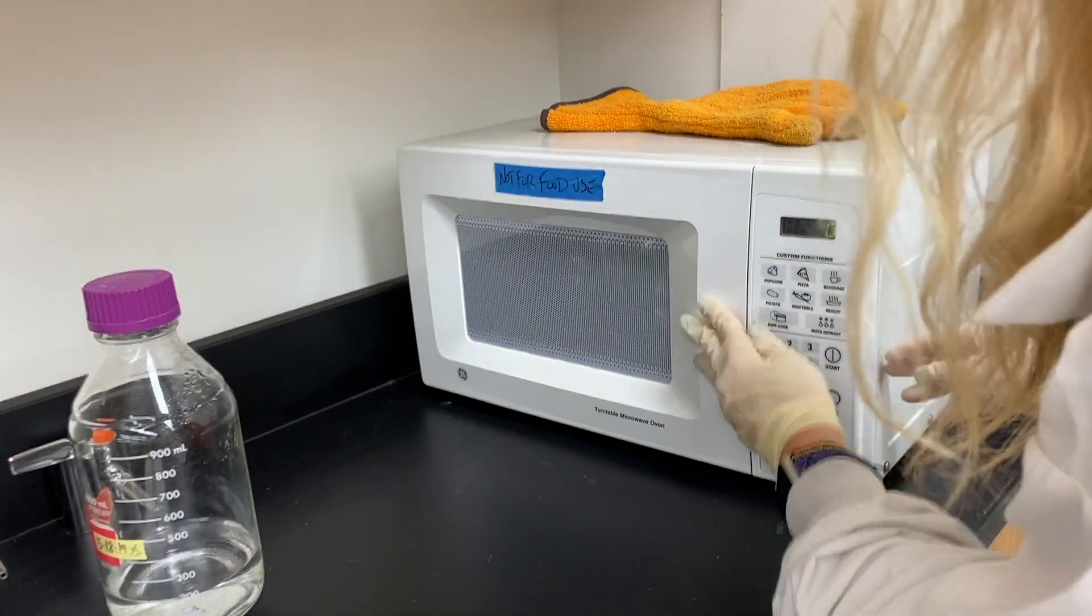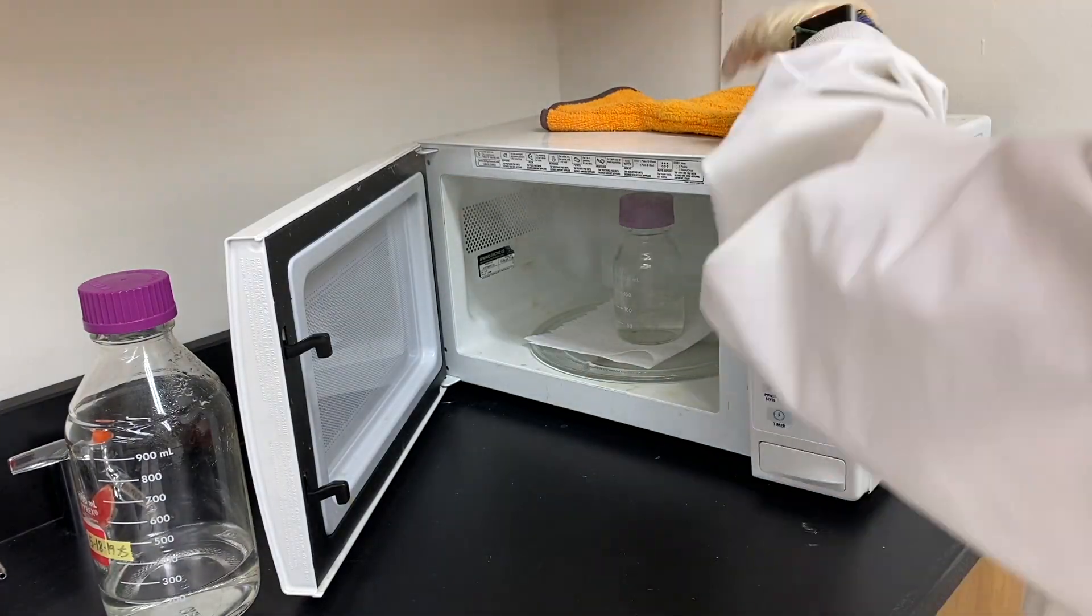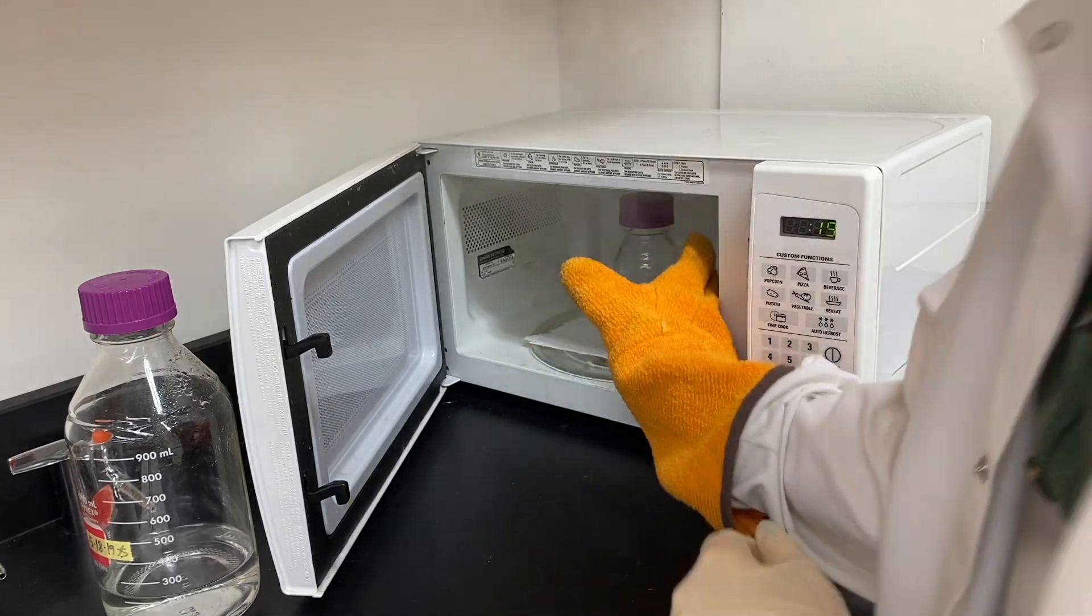And general rule of science, always assume glass is hot, especially when it just came out of the microwave.